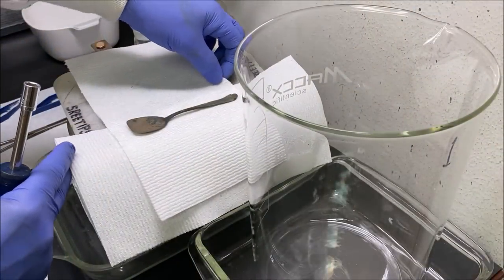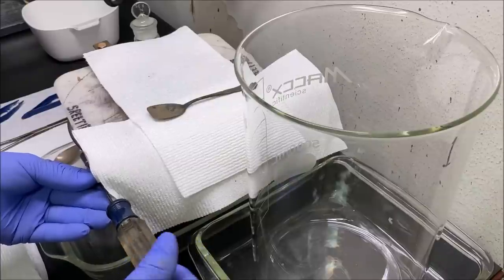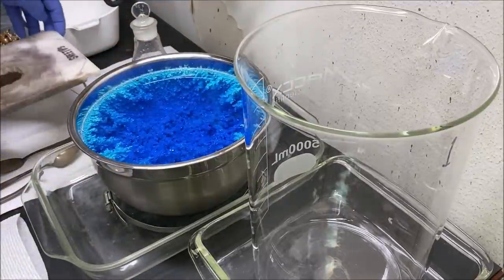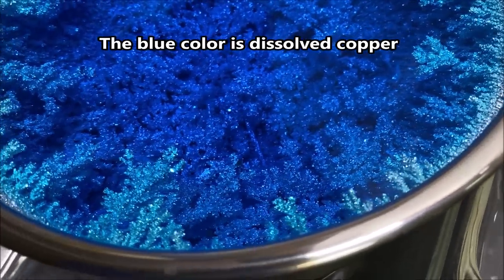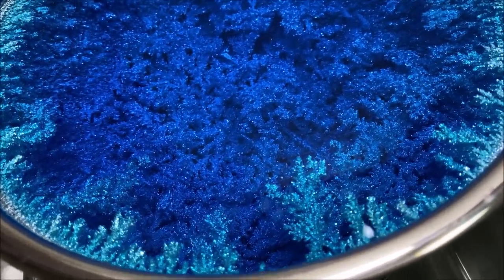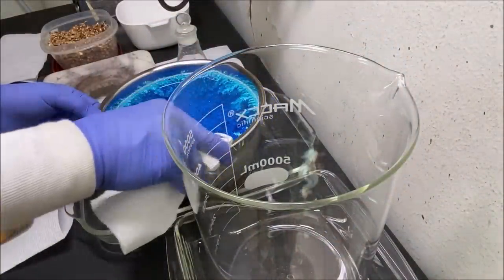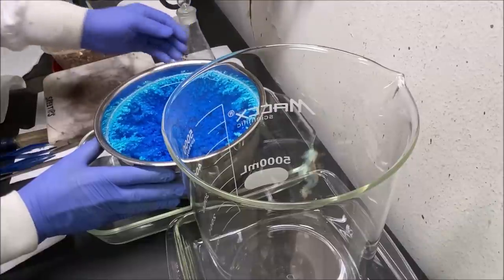Now we're going to harvest the silver crystal out of our silver cell. I'm going to disconnect the cathode electrode connection here and just let it fall down into this dish. Here's a look at the high purity silver crystal in the bottom of our silver cell — that should be about 1.5 kilos of high purity silver crystal. I'll carefully pour off the used electrolyte, as I plan on using it a second time, collecting it in this large beaker so we can reuse it.